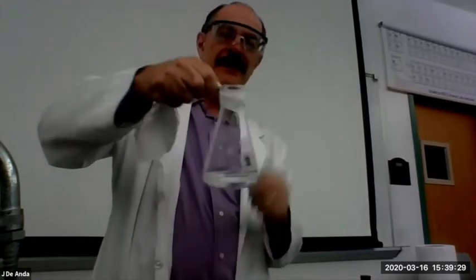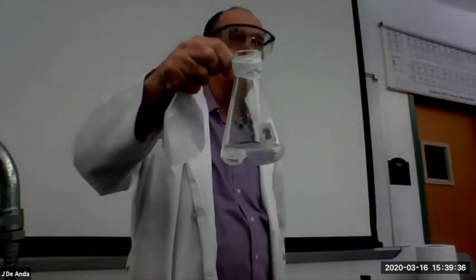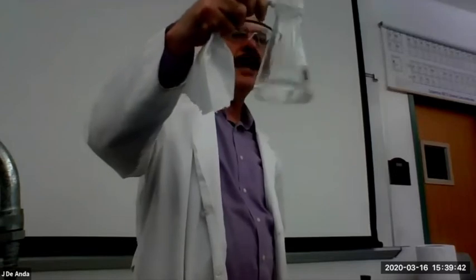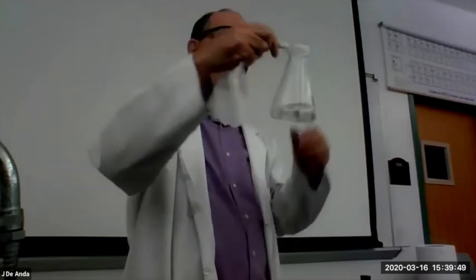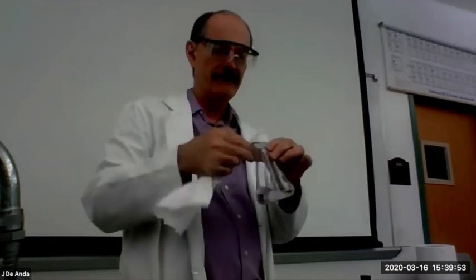And that'll give you a little collar to hold your flask. And then what you do is you turn on your Bunsen burner. I don't know what happened to mine. Very gently, let it float over the flame. Don't get it too hot. You don't want it to boil. But the heat helps dissolve the acid. And once it's fully dissolved, bring it back and let it cool down a little bit back to room temperature. All right?